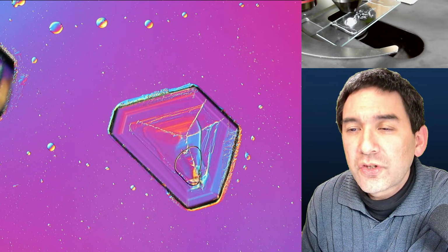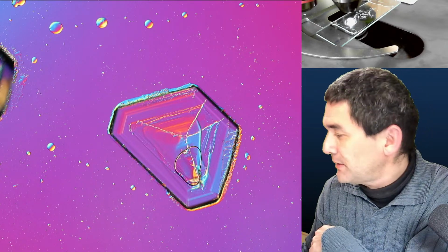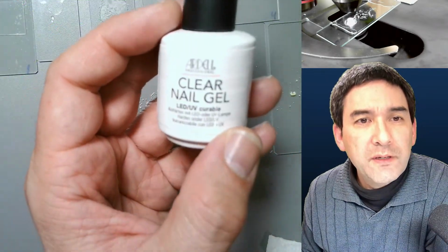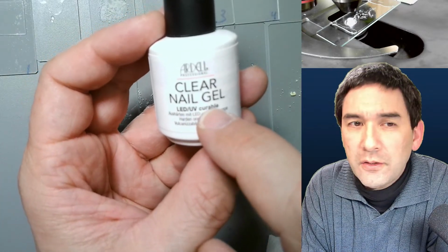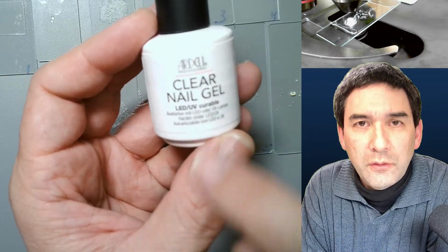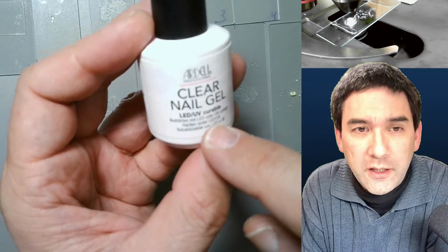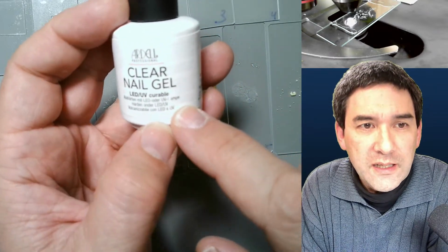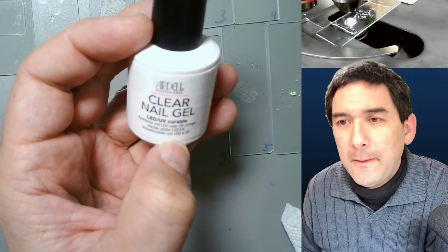So, Sir Microbehunter, is this then the regular nail gel or UV gel, or does UV light also work with regular gel? No, UV light does not work with regular nail polish. This is specifically UV. It says here it's LED UV curable. I think what they do is you put some nail polish on your fingernail, and then I think this is put over it to make it shiny. I don't know. I'm not so much into cosmetics, so I don't really know much about this. The only thing is that I was specifically searching for one where you can use ultraviolet light.